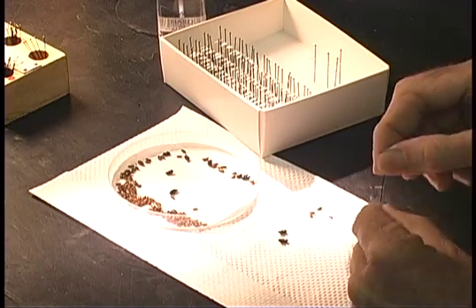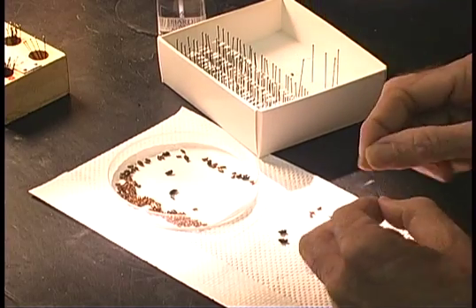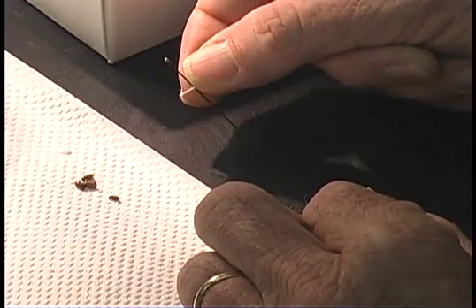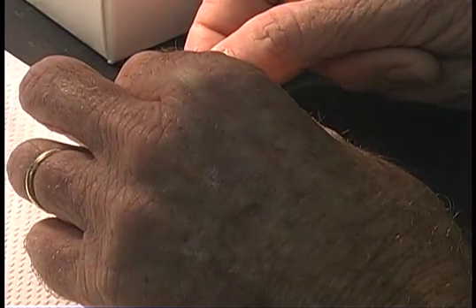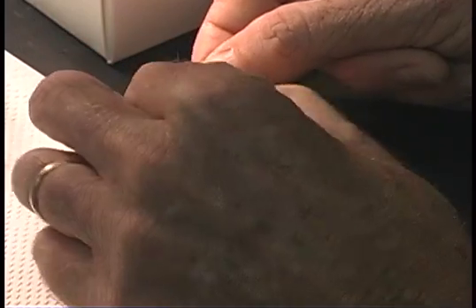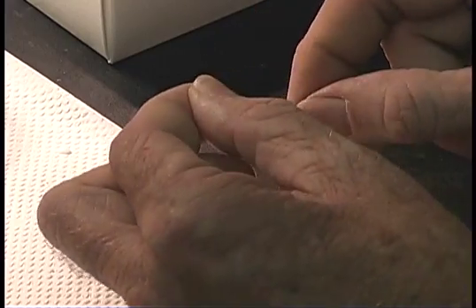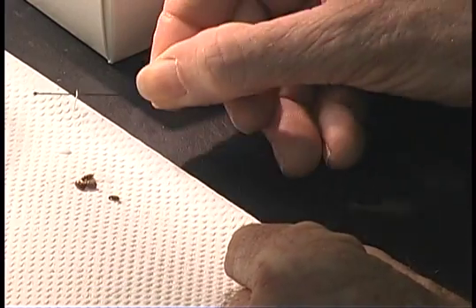I have done this so much that I do it without thinking. So let me take you through that one more time. Hold the point by holding the base of the point. Using your fingernail, modify the tip of the point so that it is bent downward and will fit against the insect's body in the appropriate place.